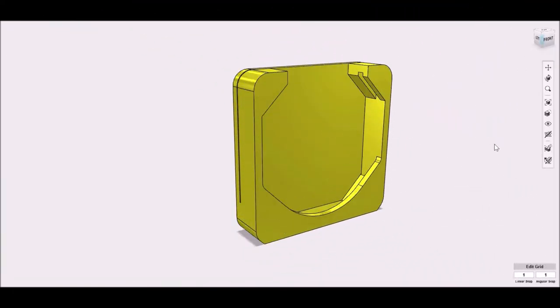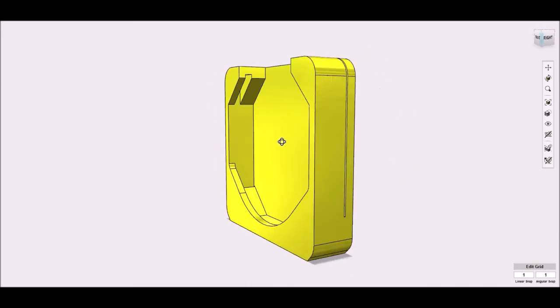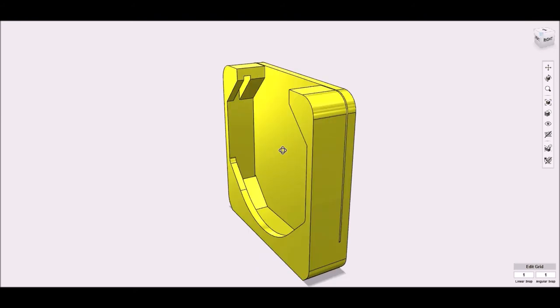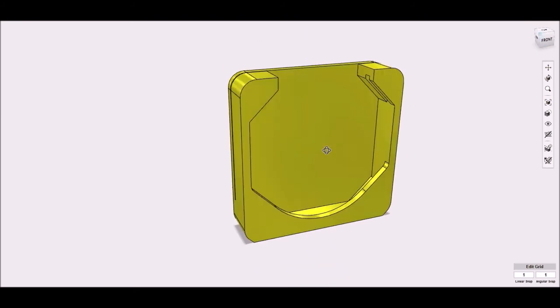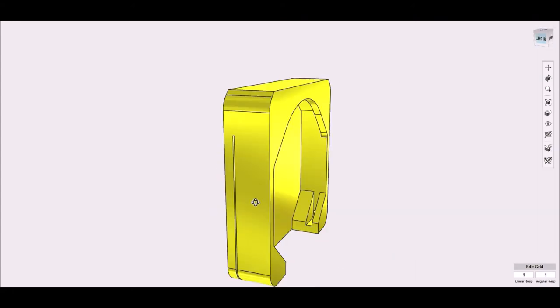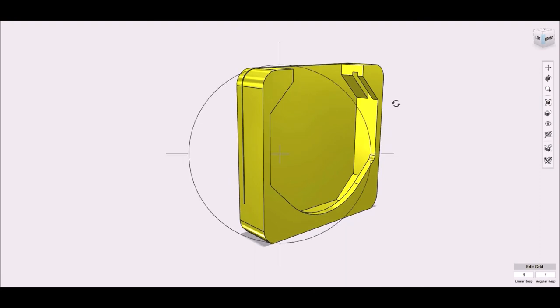This next print is the cover for the Raspberry Pi high-quality camera. The two arms at the sides have to bend out to allow the card from the Raspberry Pi camera to slide into place. After sliding the camera circuit board in, the two arms snap back into place, holding the circuit card securely. One edge has no side to allow the ribbon from the camera a place to exit the cover. I used the same design on my previous Raspberry Pi camera project, and it still works well.